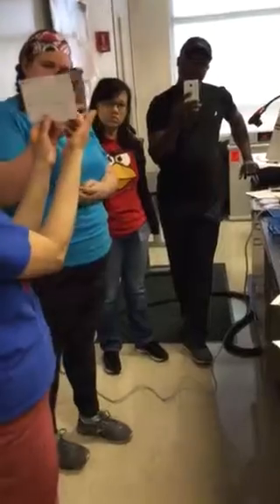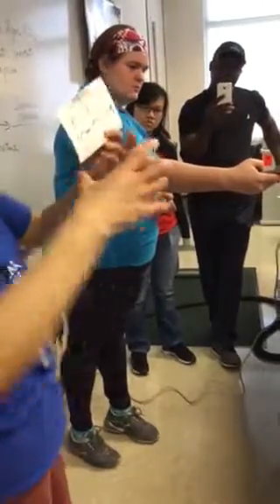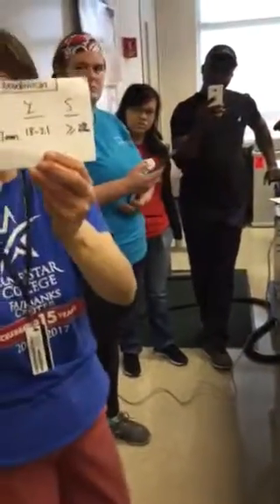So if your zone is bigger than 22, that will be sensitive. That will be a huge zone. If it's less than 17, that's going to be resistant. So this is the way to determine if your bacteria is sensitive or resistant to the drug, okay?